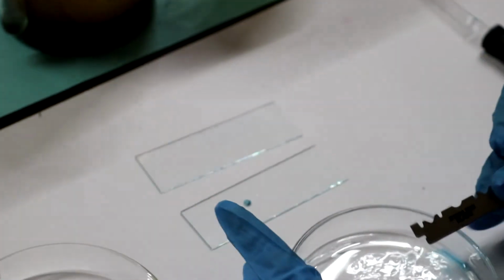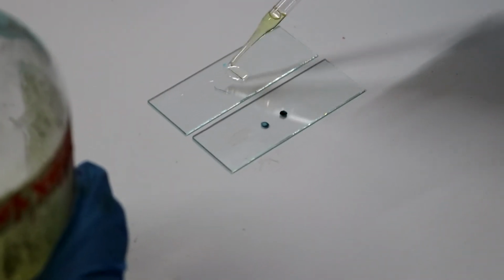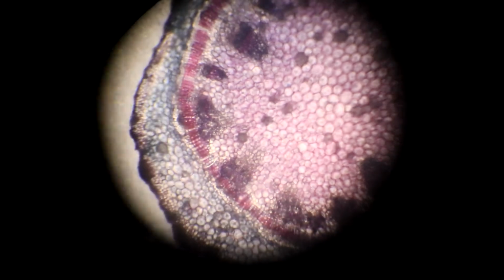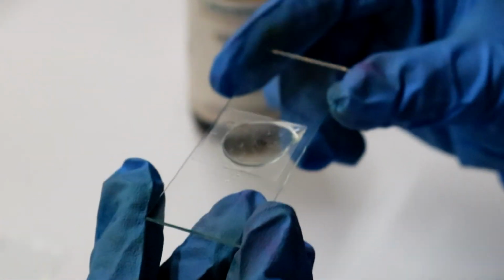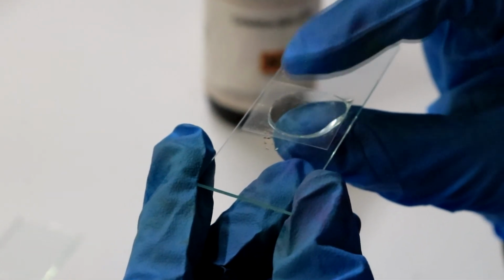After 10 minutes, take the specimens and place them on separate slides. Place a drop of xylene on each to prevent their further dehydration. View the sections and select which will be most suitable for mounting. Finally, mount your finalists in Canada Balsam. Place a cover slip on top, let it dry, and then finally, label your slide.